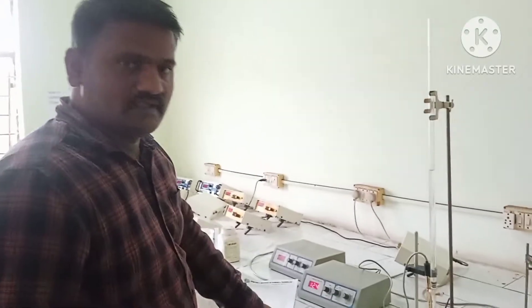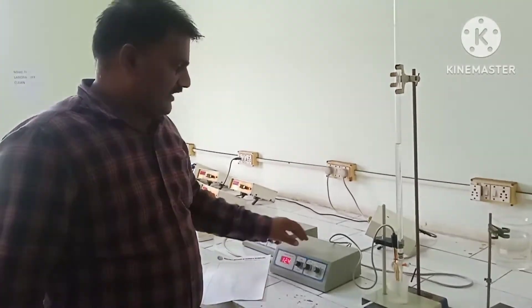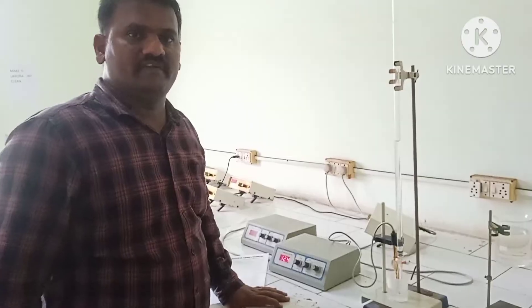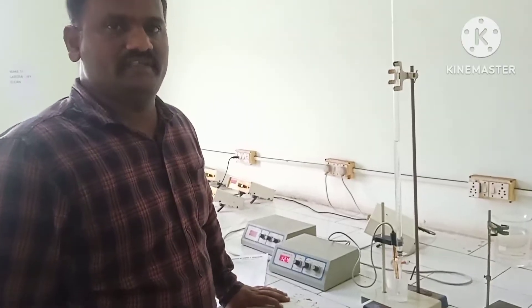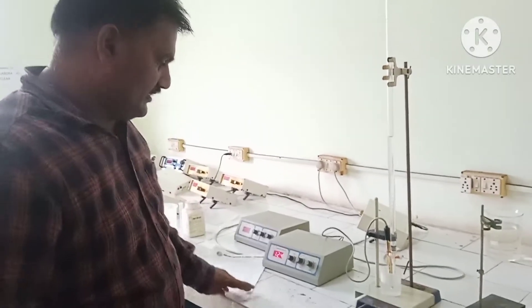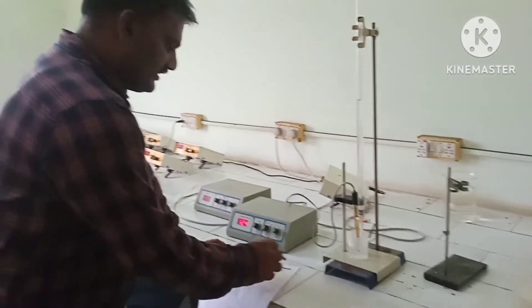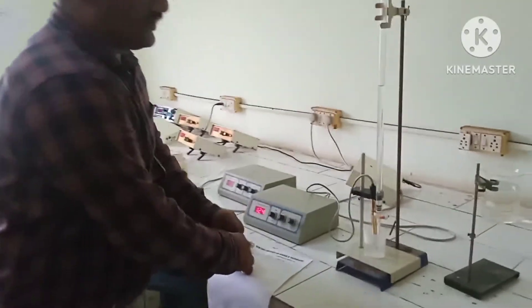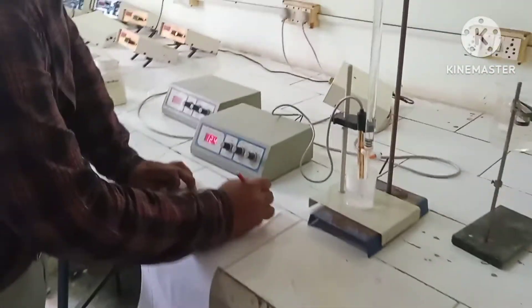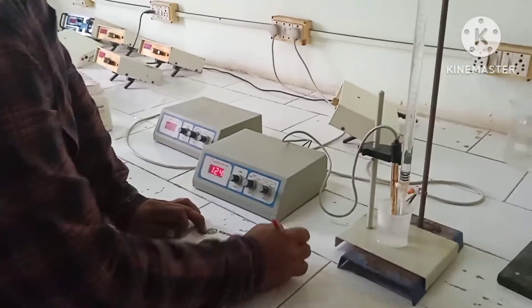Good evening to everyone. This time we will test conductivity. What is a strong acid and strong base? Strong acid and strong base — for example, strong acid is like HCl, and strong base is NaOH.